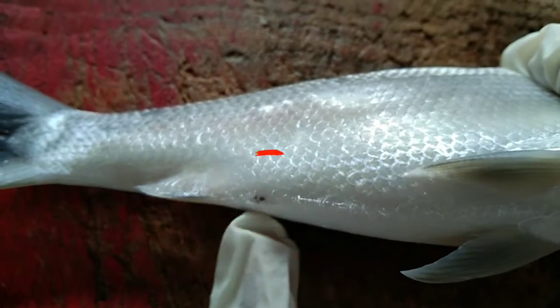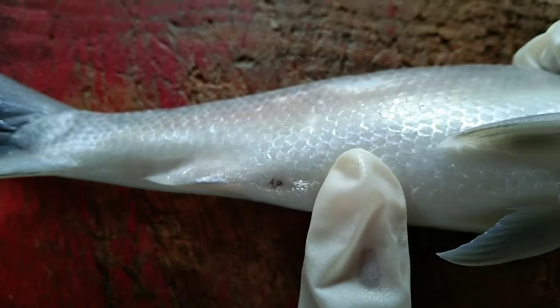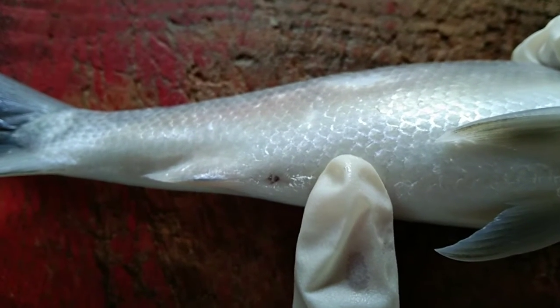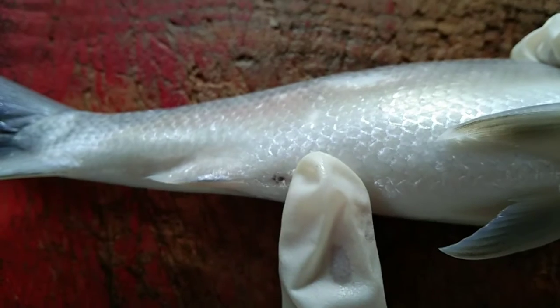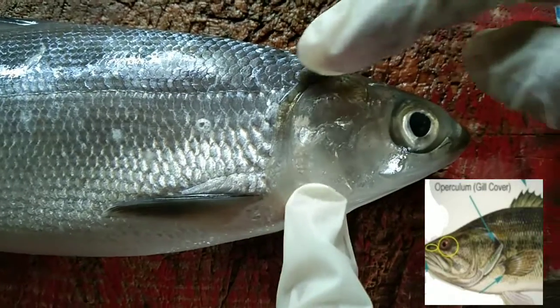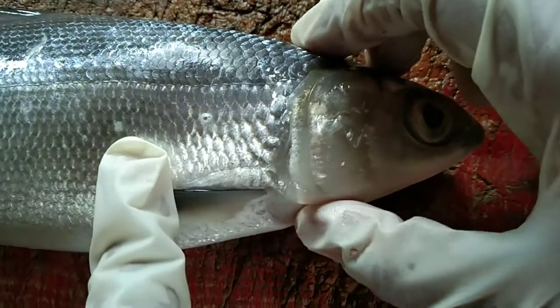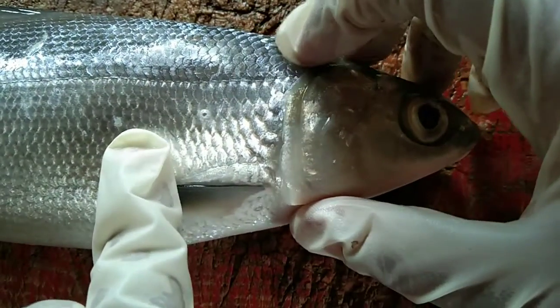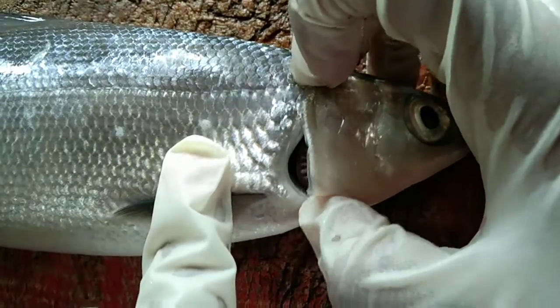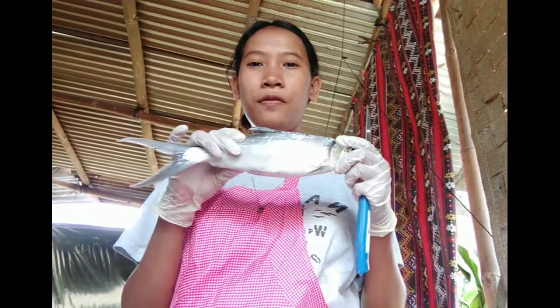This is the vent of the fish. It is the external opening to the digestive, urinary, and reproductive tracts. This is the gill cover, or the operculum. It is the hard bony plate that covers and protects the gills. Now let us explore the internal parts of this fish.